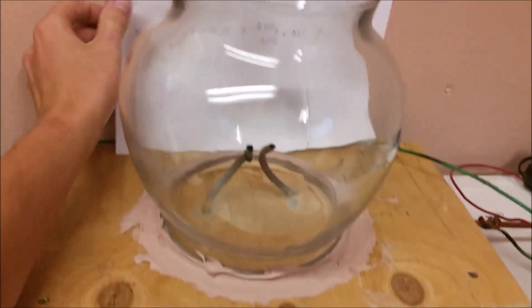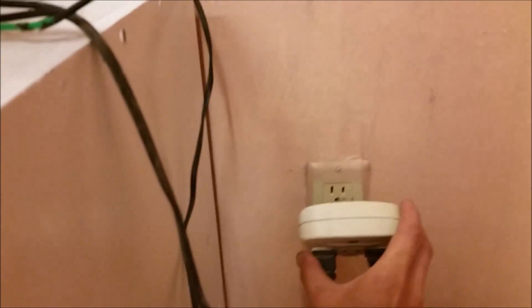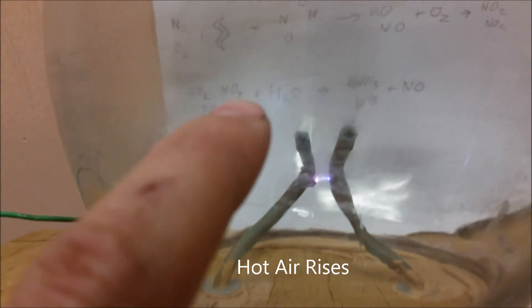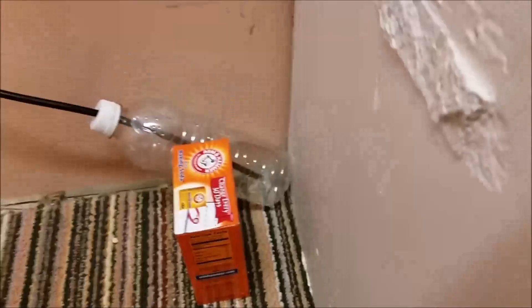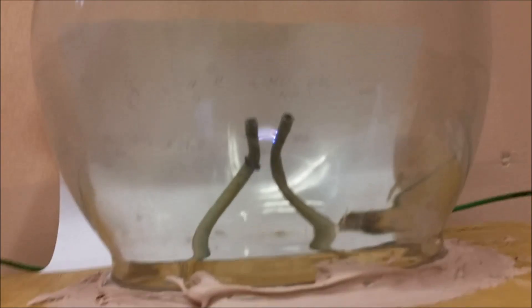Let's put this white paper behind this bulb so you can see the brown gas that forms. Let's go ahead and plug the bubbler and transformer in. There we go — you can see we've got a nice little electric arc going. As this heats up, that electric arc will jump up to the top there. We've got bubbles of air coming through. For some reason my bubbler stones didn't work — my air pump must not be powerful enough. This still will work, it just won't be quite as efficient. You can see this arc is starting to bounce around. Very nice. I'm going to let this thing run basically all day.